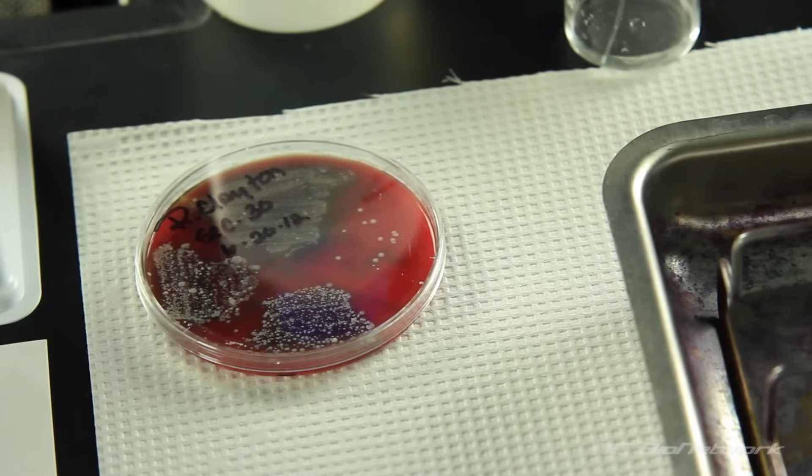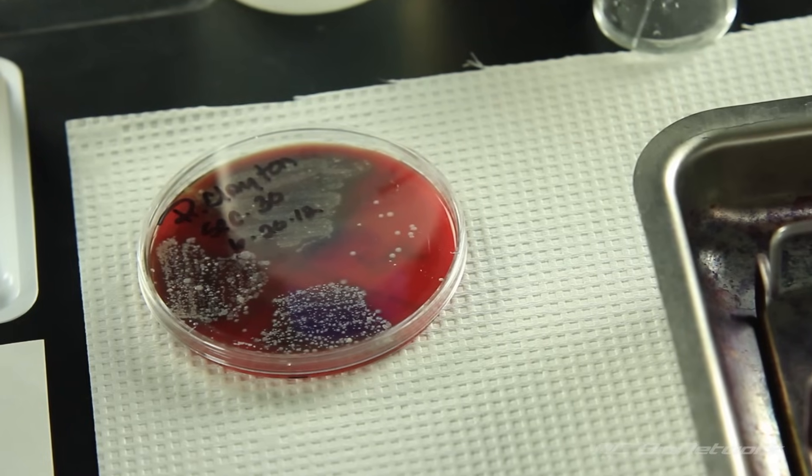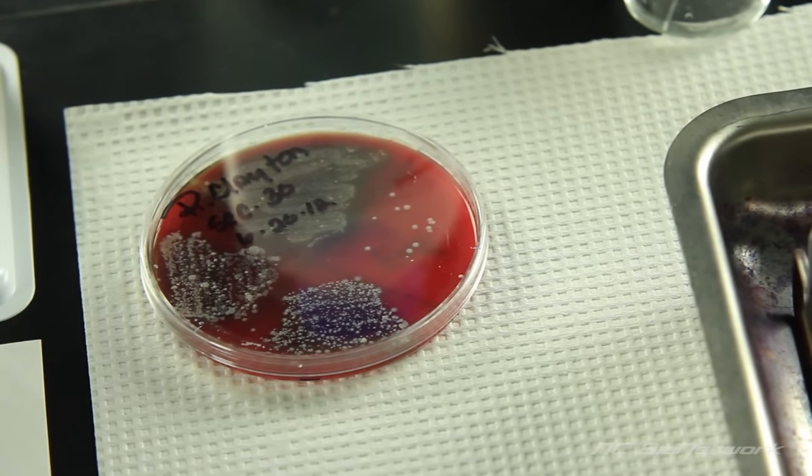In this experiment, we will demonstrate the steps for applying a simple stain to the bacterial organism Staphylococcus.